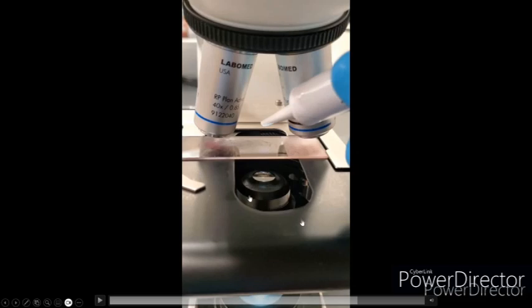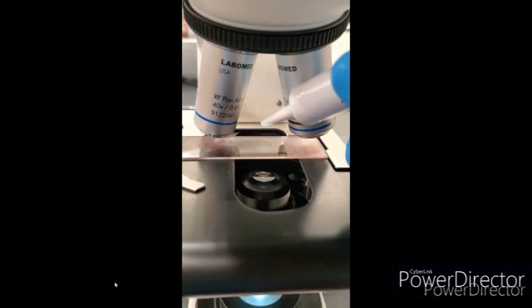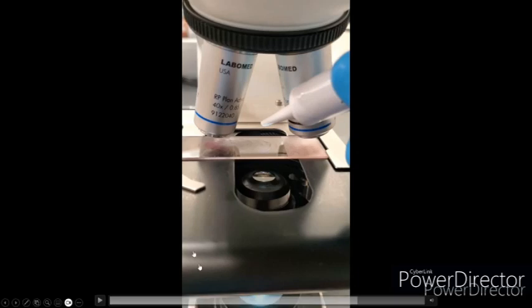Scanning, trying to get a good feel, looking at the gram stain, seeing how well the gram stain is in regards to: is it all purple or is it all pink? Is it a mixture of the two in some places? Is the organism too thick? Are you able to actually see what the organism is because there's too much or too little of it? So the 50x will give you a good judgment of that type of question.